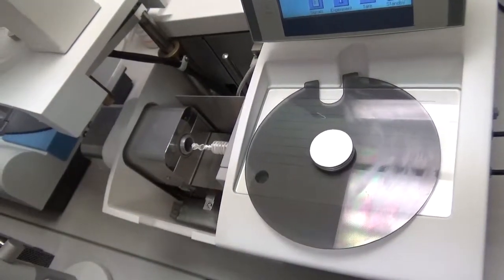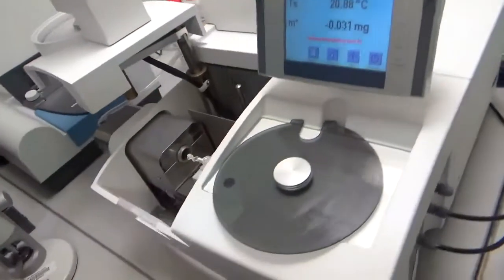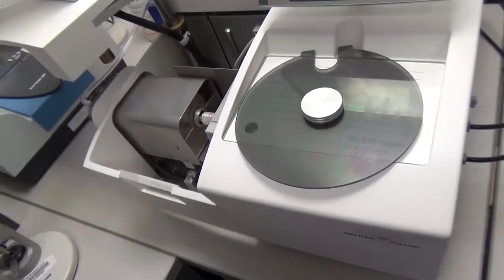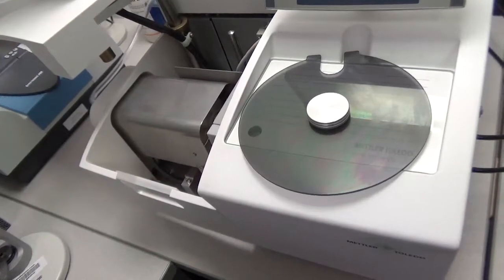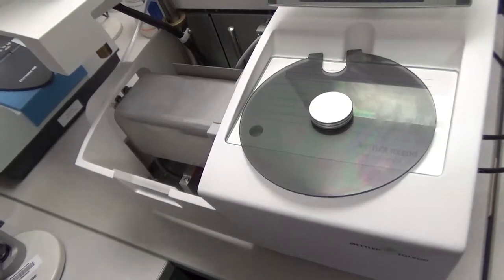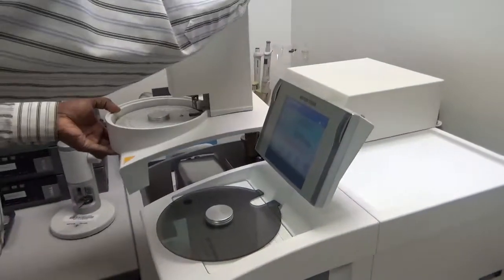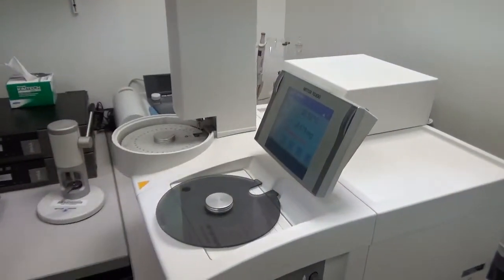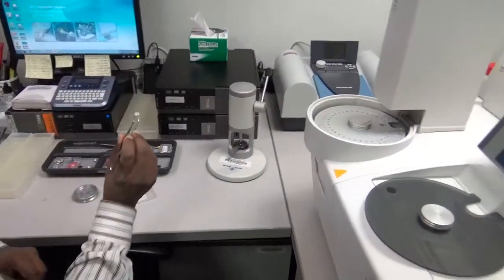The reference crucible always stays there. To close the furnace, you press the furnace button. Once the furnace is closed, you can bring the robot down. To load a sample, first we load the empty crucible to get the weight of the empty crucible, then we will tare it, and then we load the sample and take the weight again — we start with the initial weight, and then the weight changes occur with controlled heating.